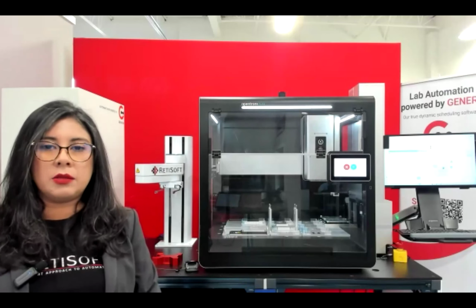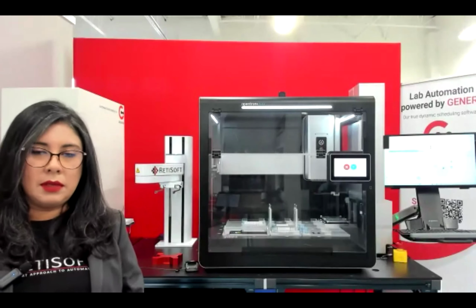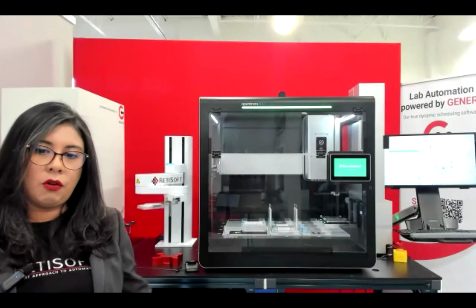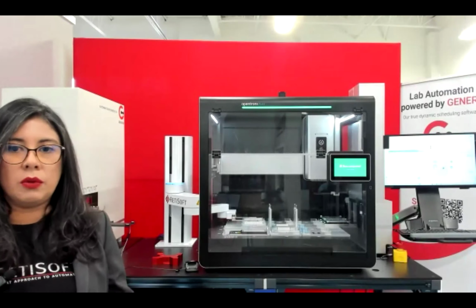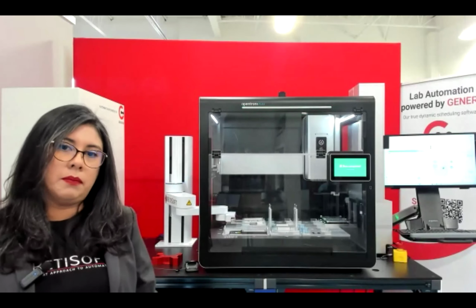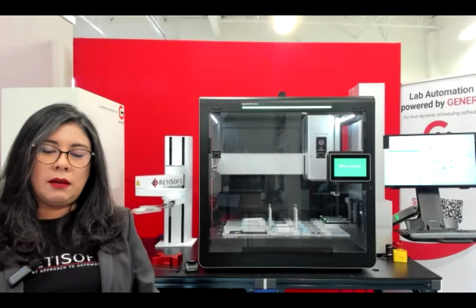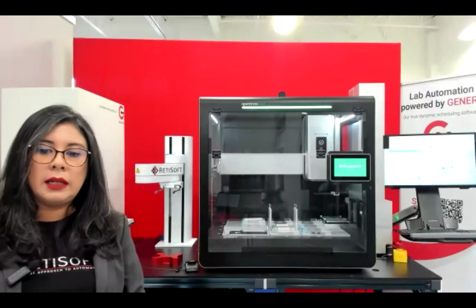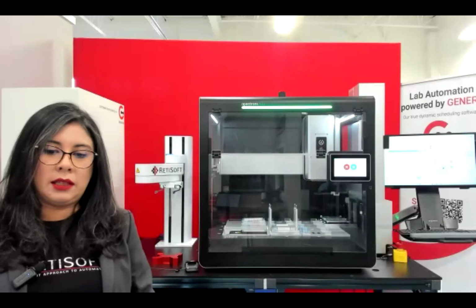For over a decade, it has become the standard in laboratory automation mainly for the compact design that it offers, as well as the safe operation and precision that it brings to the system and the handling of the microplates and samples. So to enhance those features of the robot, we have built our own teach pendant in Genera, which also gives you a lot of power when you are integrating the system.